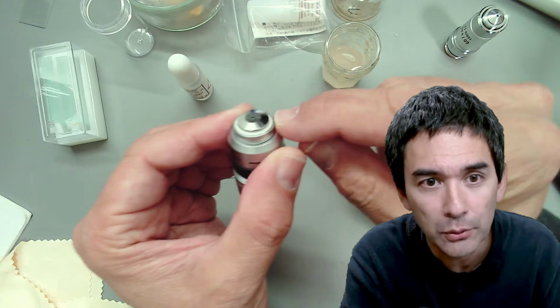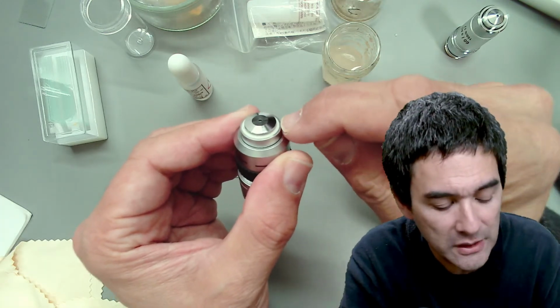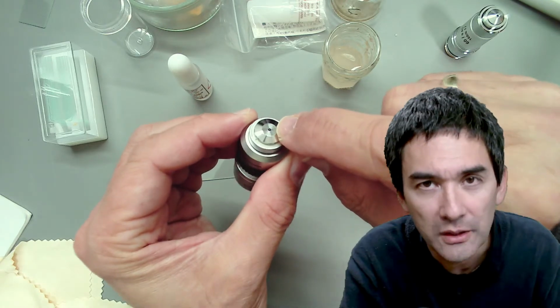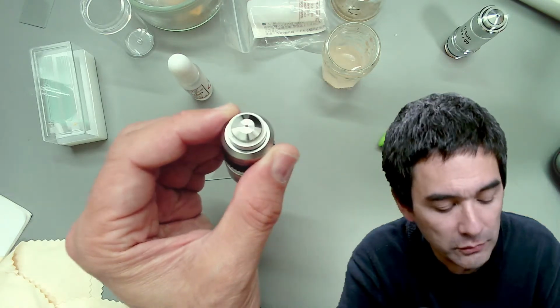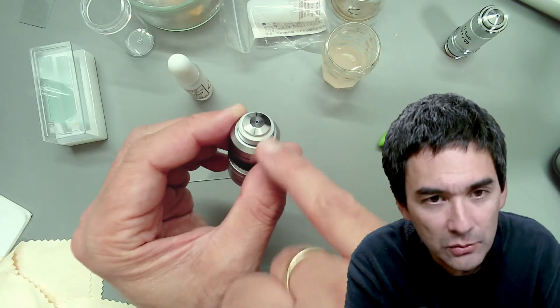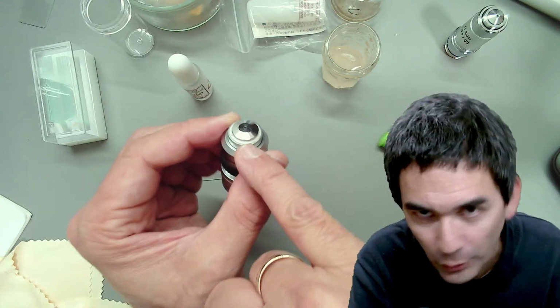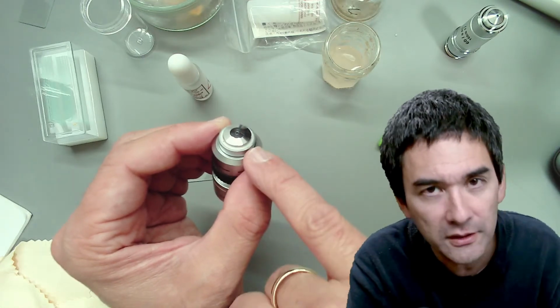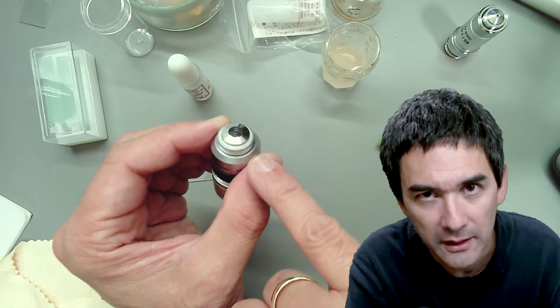Now if you use an improper solvent, you might actually damage these things, or sometimes the lenses are also glued in place. So what you generally want to do is prevent any liquid flowing into the lens, of course not the oil, and of course not any cleaning solvent. And the solvent that you use should be very volatile.